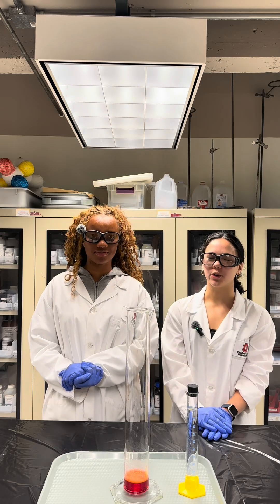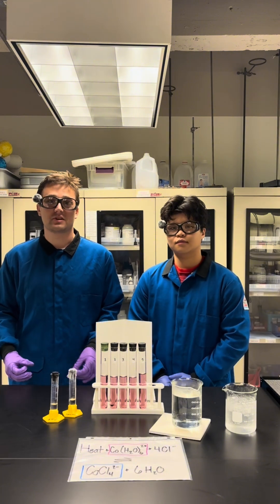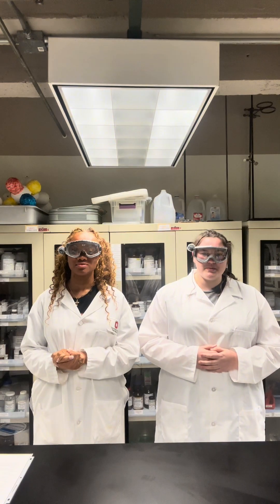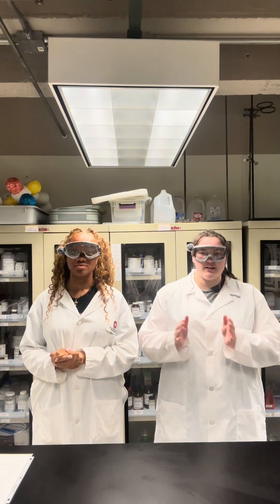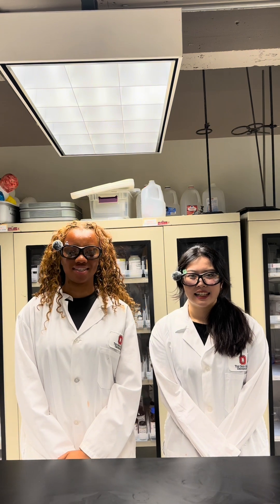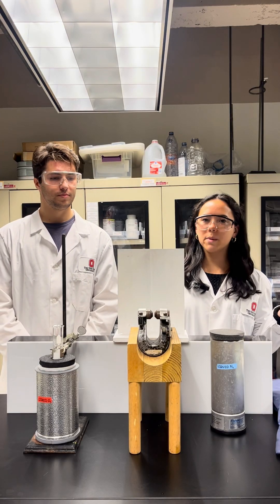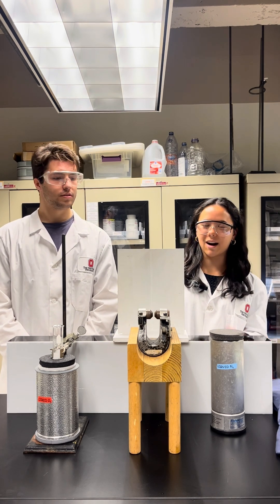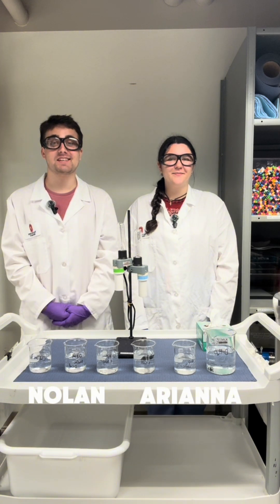Today we're going to be showing you guys elephant toothpaste. Today we are going to be talking about Le Chatelier's Principle. Today we'll be working with the common ion effect. This week we're going to be demoing the difference between unsaturated, saturated, and supersaturated solutions. Today's topic is chemiluminescence. Today we're going to be demonstrating the difference between paramagnetic materials and diamagnetic materials with the paramagnetic oxygen demo. And today we are going to be discussing conductivity.